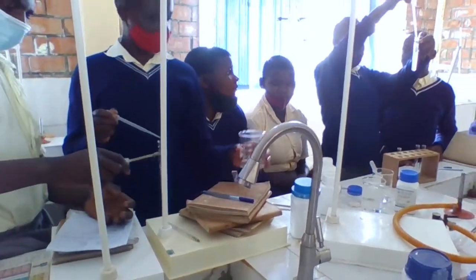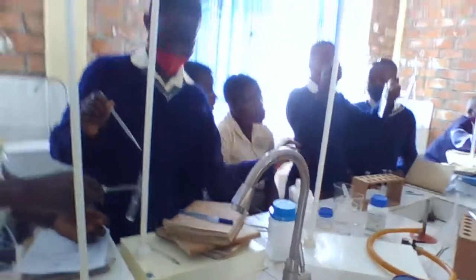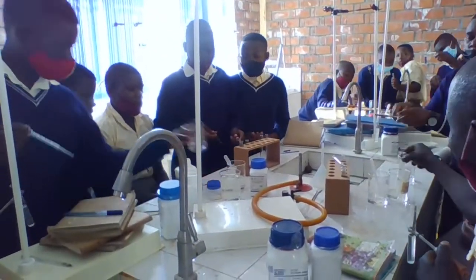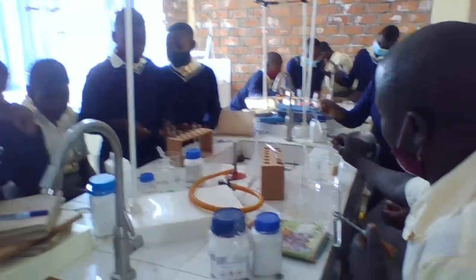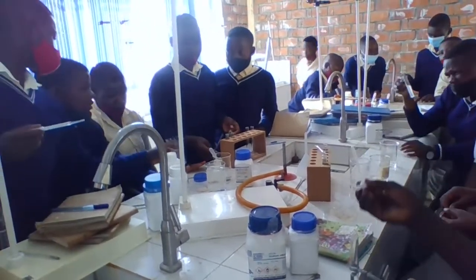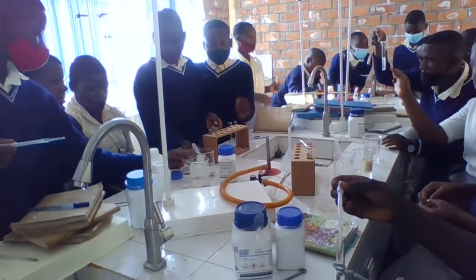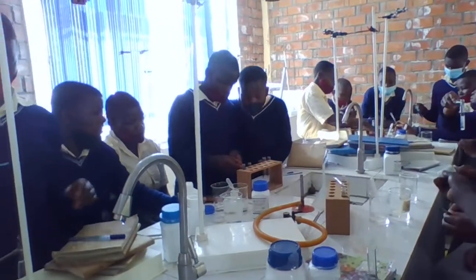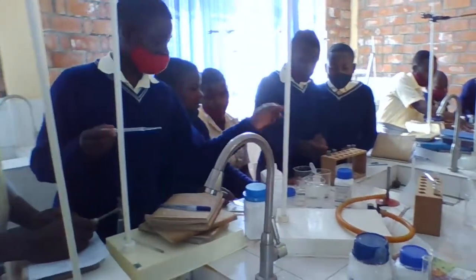Sodium hydroxide. Okay, take it. You put it a few drops until excess. Okay, you shake. Shake. Yes.